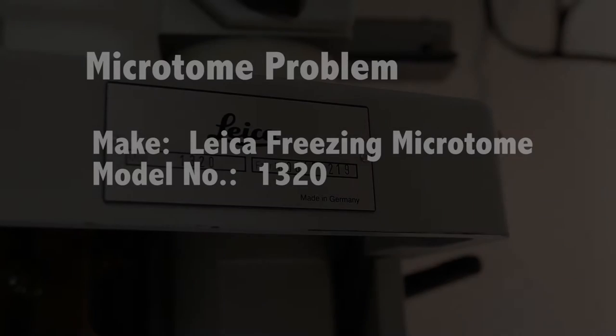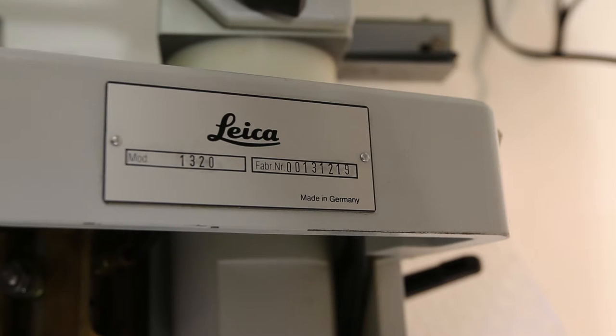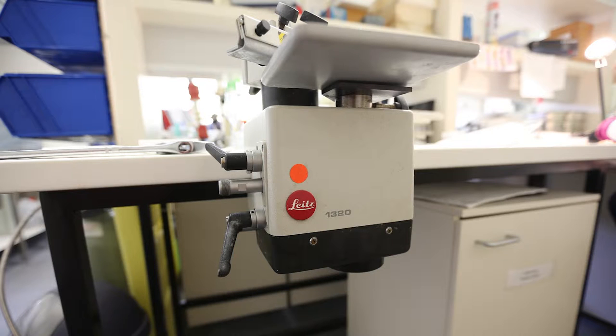Hi, my name's Hayden Allbutt, and I've got two Leica freezing microtomes. They're both model 1320, and I've been having a problem with them recently.